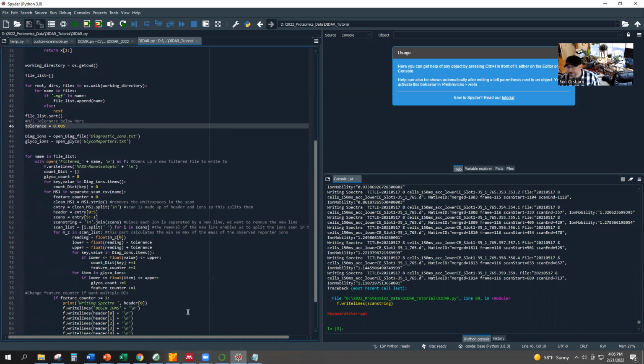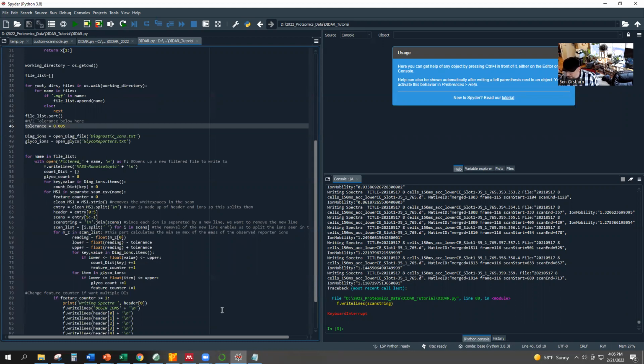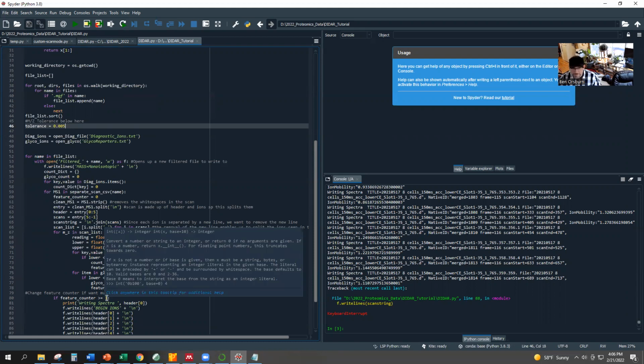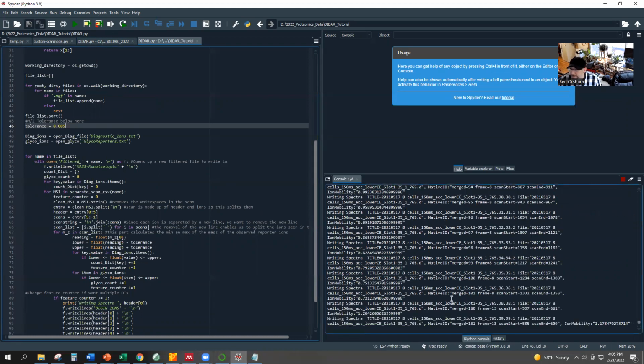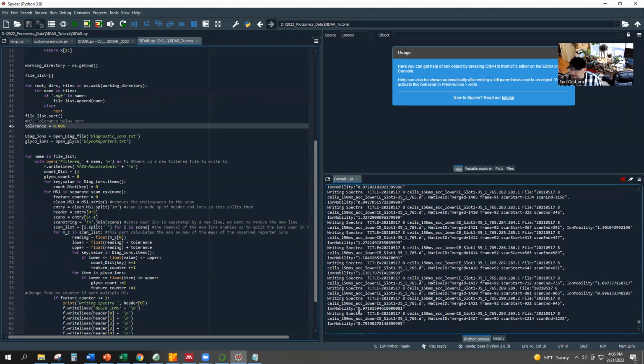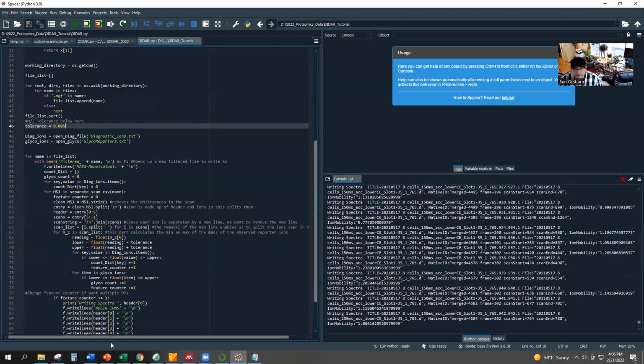And for illustration purposes here, I'm just going to go ahead and say, if you have one diagnostic ion from one single cell, I want that data. So I'm just going to keep that one. But if I will only be interested in a spectrum if it's got a detectable reporter ion with it from at least 5 single cells, then I just change this number to 5. Right? 5 or more single cells, and that's all we do. And then you hit the play button. What'll happen here is a whole lot of text will start running, and as it's going through this timsTOF file, you get the scan header for it, and it builds through.